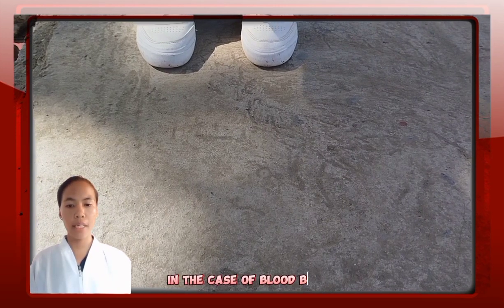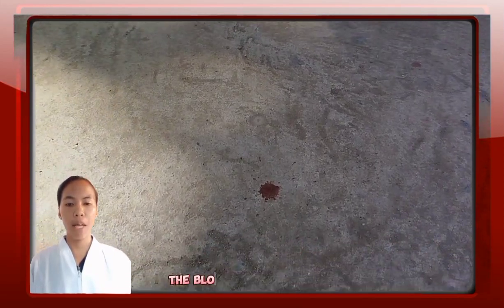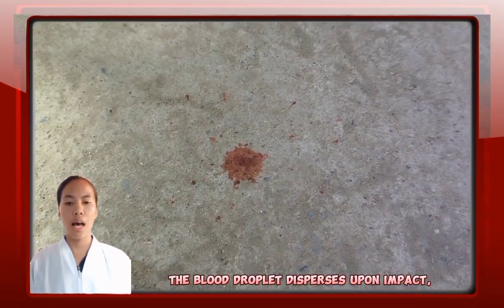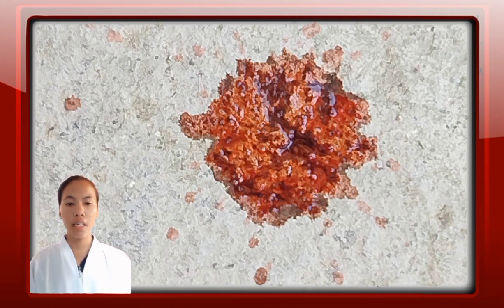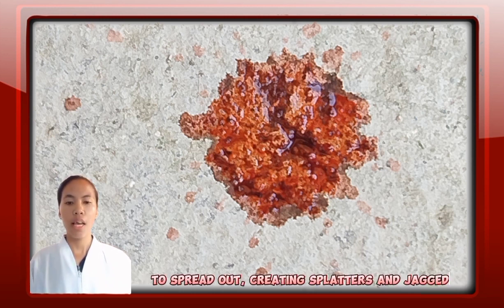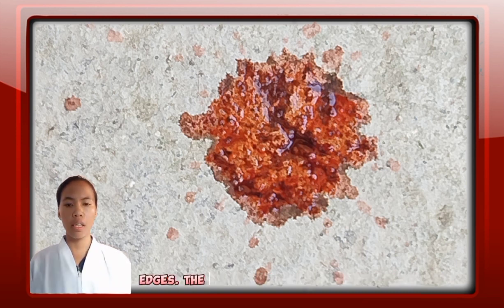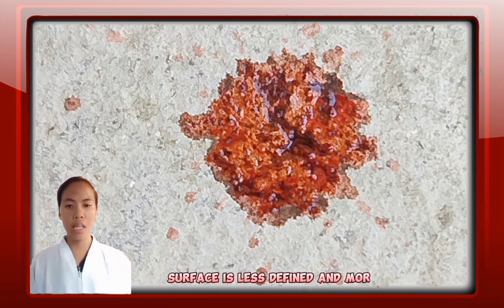In the case of blood being dropped onto a rough surface from a height of 5 feet, the blood droplet disperses upon impact, resulting in an irregular shape stain. The rough texture of the surface causes the blood to spread out, creating splatters and jagged edges. The rough surface also absorbs the blood, causing it to adhere to the irregularities of the surface. As a result, the stain on a rough surface is less defined and more diffuse compared to a smooth surface.